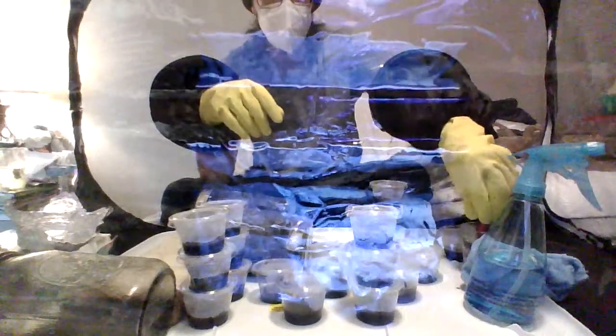All right, here's another contaminated sample. We're going to put this one on the condiment cup. Did you guys see the thumbnail? What do you think of my new character?